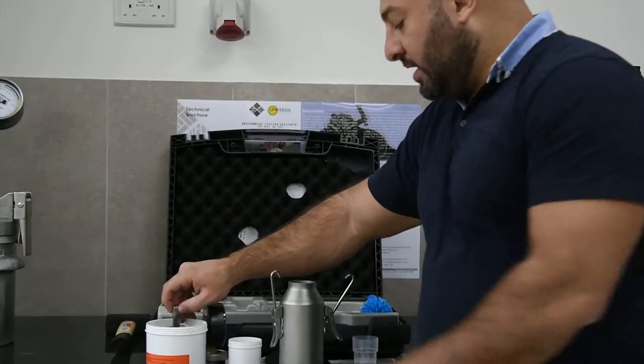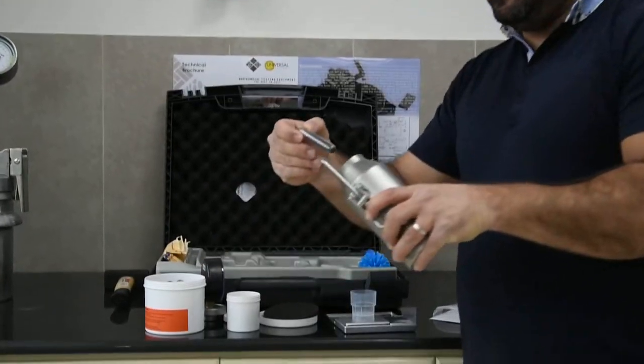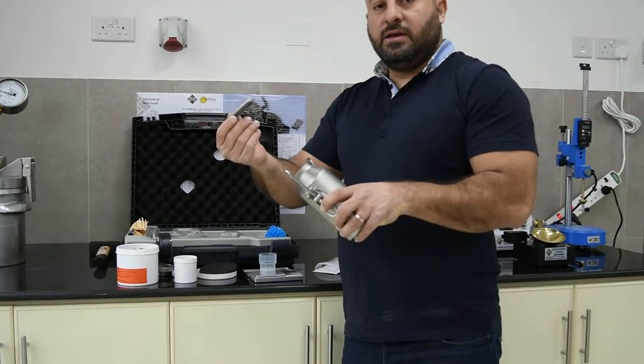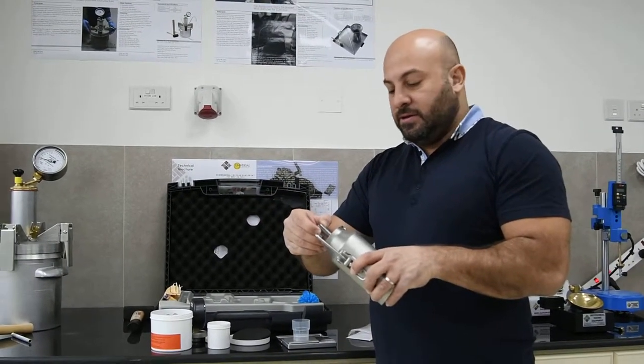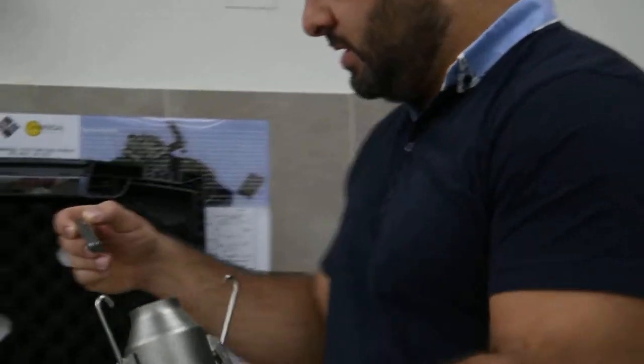And then the last step is to tilt the jar and place the calcium carbide which is capsuled in a glass container inside the actual jar.